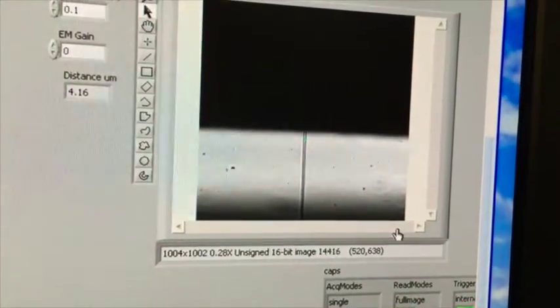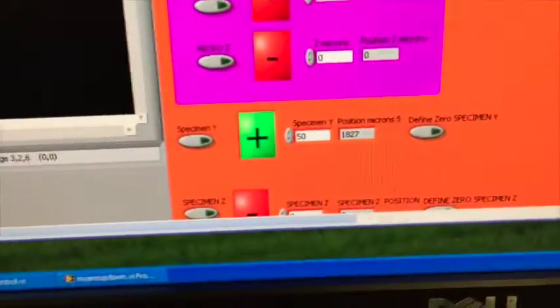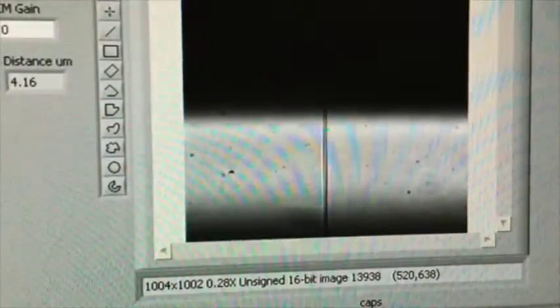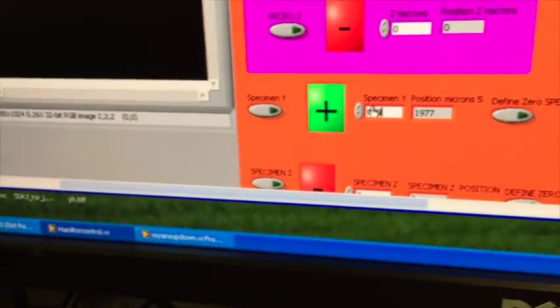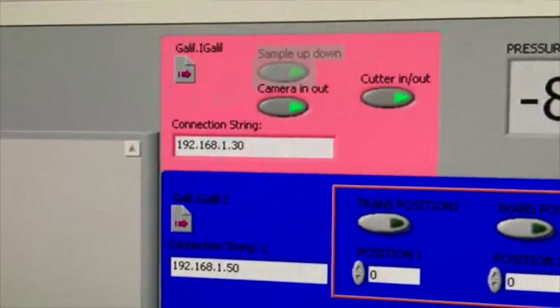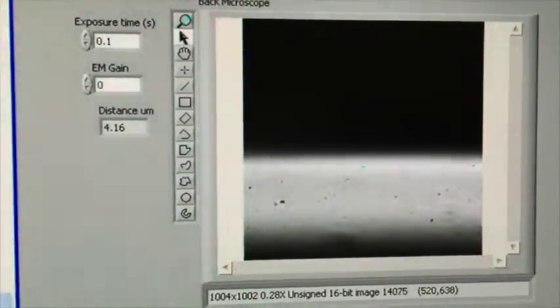Not quite in our field of view, but to show you that it is, I'm going to move our sample tip up. Again, it's in steps of 50, so I'll just use those steps of 50, and we'll see that there it is. There's the bottom of our tip. So again, I'm going to move it up 600 just to make sure I'm completely beyond the cutter. So I'm going to move that up out of the way. And now I'm going to move the cutter out. As I click this, then move the cutter in out, you're going to see the cutter go away.